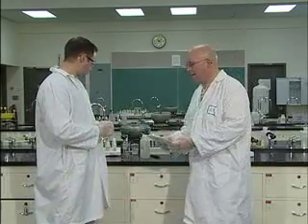So now when they're doing this lab, we're not doing it all, right? No. What we're going to do today, we're just going to do a sample from each part of the lab. For part A we're going to do the whole thing because there is only one part to part A. For part B we're going to do the magnesium portion of part B. The fun one. For part C we're going to do C part 1. And for part D we're going to do D part 1. And just a portion. When they're doing their own lab, they'll do it all and just follow step by step. In your lab manual, it's very straightforward. It's very well written, so you can go through it step by step.